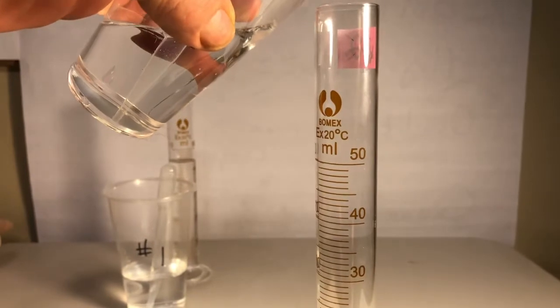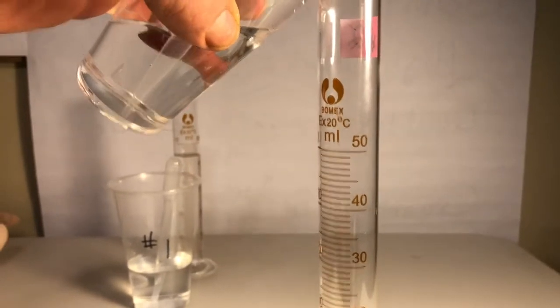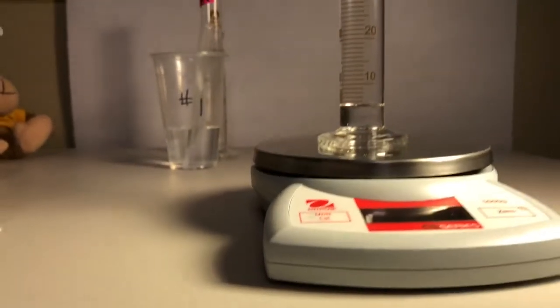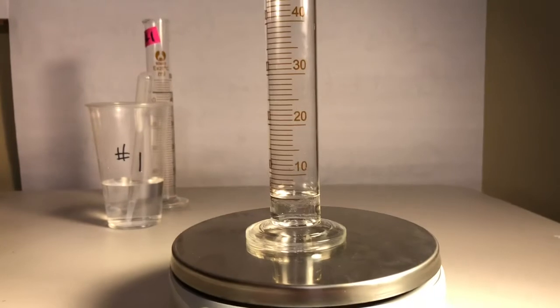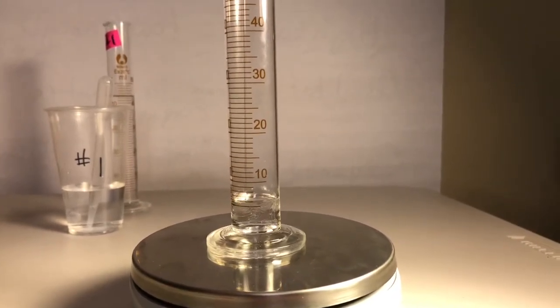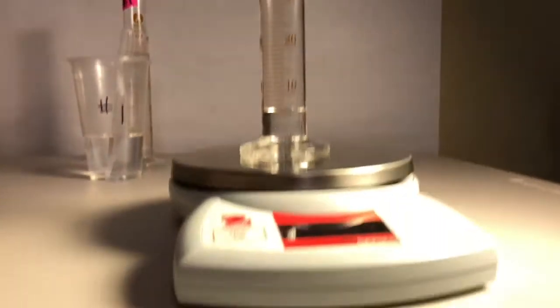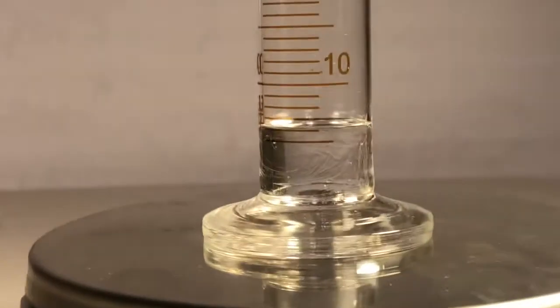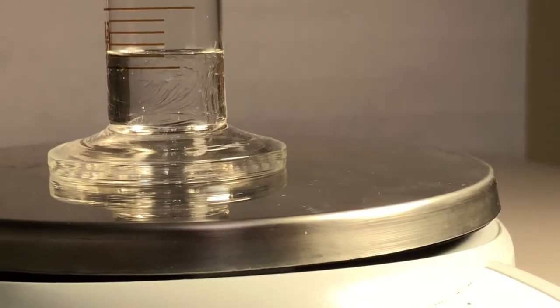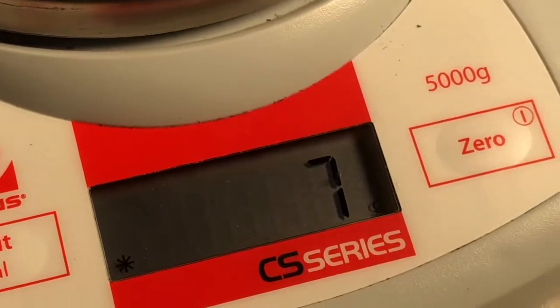That's crazy. Get in there. Or don't. Okay, I don't care. Oh, gotta do a little more though, because I just barely got that first line. All right, you crazy stuff. What is going on with that crazy stuff? Let's zoom in a little bit. There you go, guys. What is that number? What does that say? Bottom of the crazy fat line, right? And now mass. There it is.